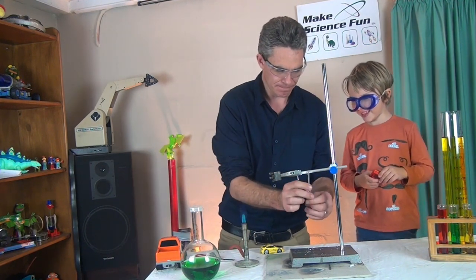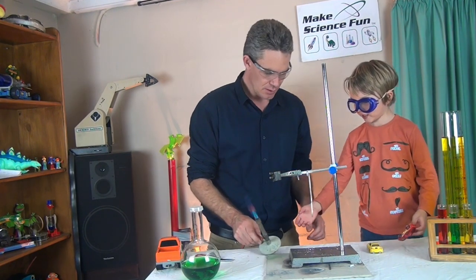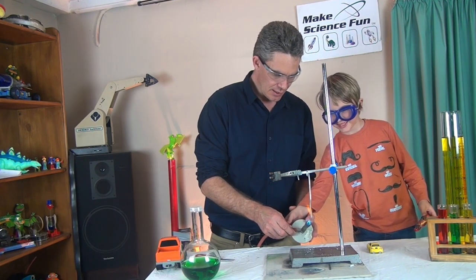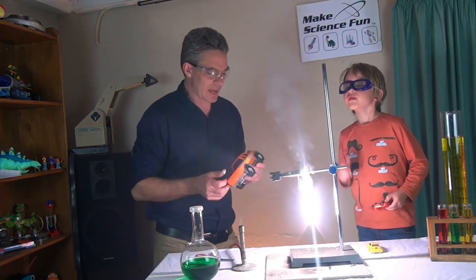Let's do it again, eh? You ready for it this time? Do you want to hold the Bunsen burner this time? Just a little bit. Heating it up. Keep going. There we go, it's ignited. Imagine having that burning on the back of your car.